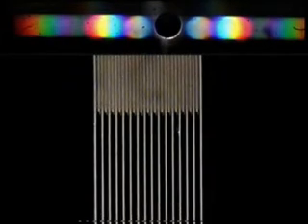Just to demonstrate that, here we have another grating on the slide where the contrast is already the other way round. When we put in the stop to get a dark field image, you'll see that the contrast is not reversed. So the general case is not that contrast is reversed. The general case, in fact, is that scattering features appear bright and the background becomes dark.